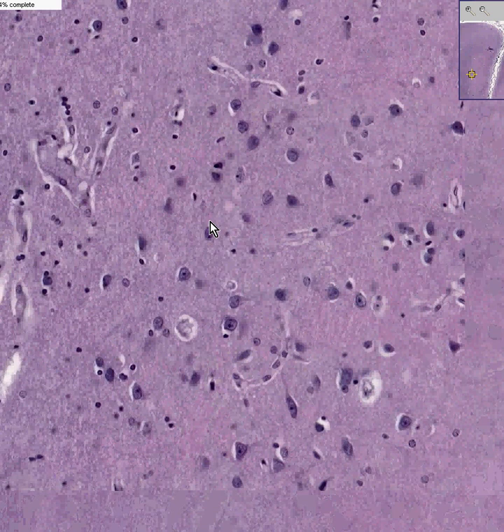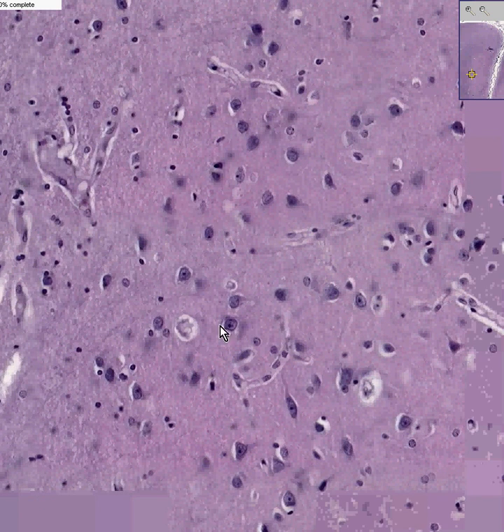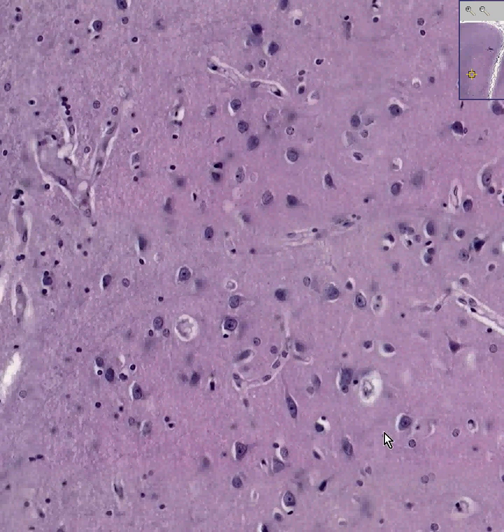Now here we are in the area where there are some neurons, and you'll see small cells like here and here and here. They may be some oligodendrocytes, but they're more likely to be astrocytes. Perhaps here and here I think would be good candidates for astrocytes, because you could see a blood vessel here and you could see a neuron here. And the chief function of an astrocyte is to be a go-between between neurons and blood vessels. They are the blood-brain barrier.